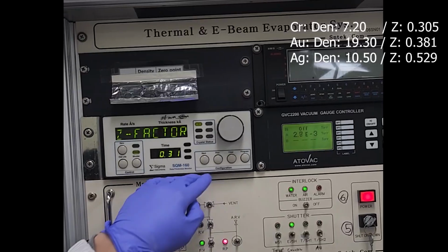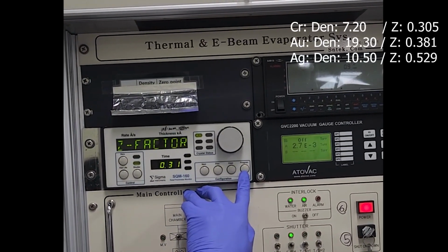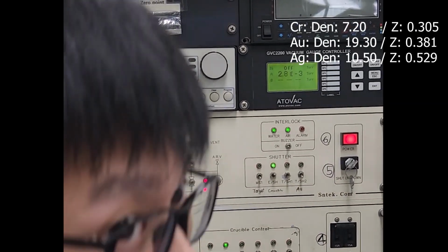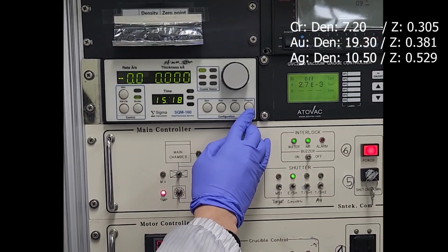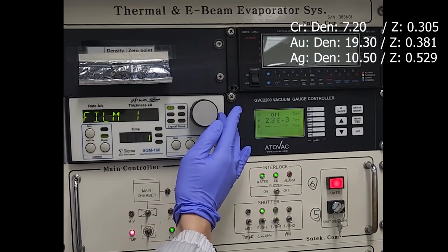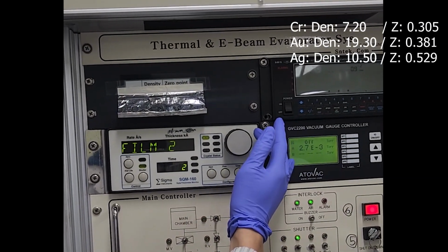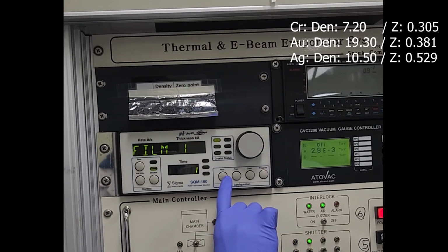After checking, click program again for setting up the materials. Again, first click program, and then rotate here, for example film 1 or film 2 or film 3. You should check, and then rotate to film 1 like this, and next.